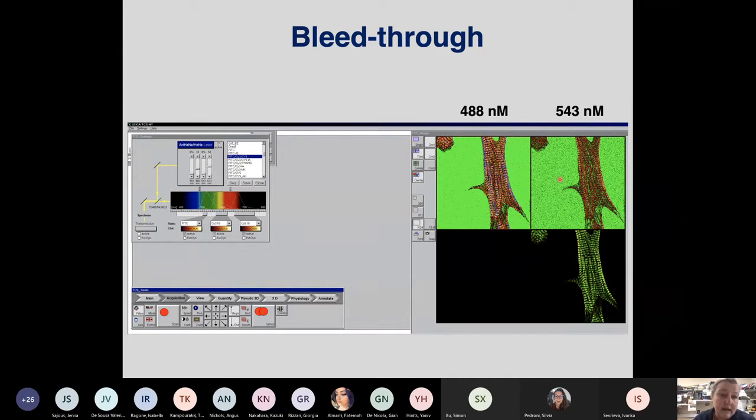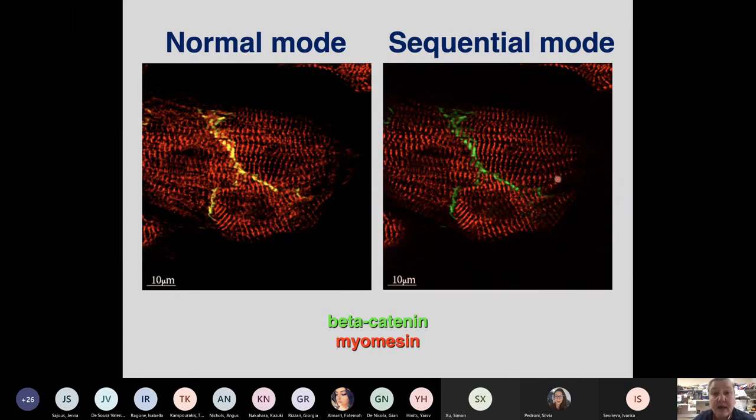And this is why the majority of confocal microscopists will recommend that you scan your sample sequentially, so that you don't scan the green and the red at the same time. And again, you can come to completely erroneous conclusions, because if you scan them at the same time, you would assume that, okay, so we have yellow, we have colocalization, so myomesin is a protein of the intercalated disc. Now, since 1984, when myomesin was first identified, it was never seen at the intercalated disc. So this is just something that the confocal microscope has invented because you haven't used the appropriate imaging conditions. Whereas if you use sequential mode, they're beautifully separated and there's no problem at all.